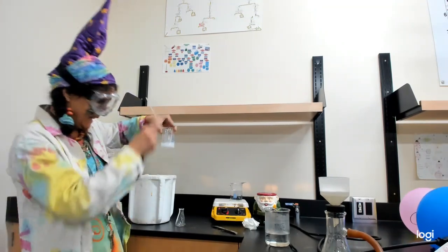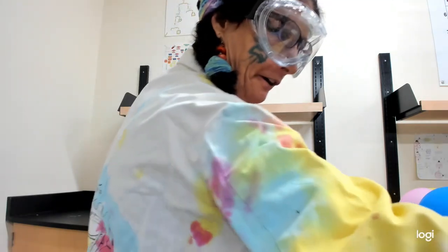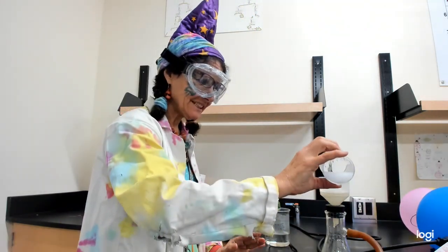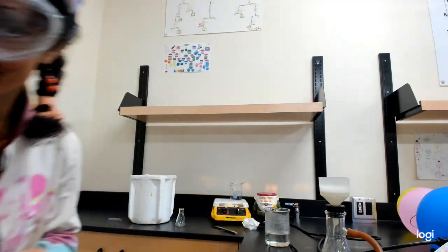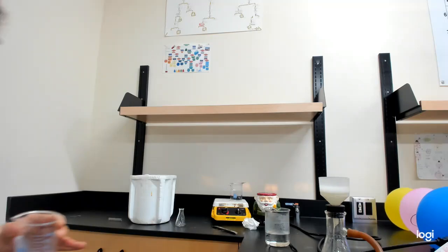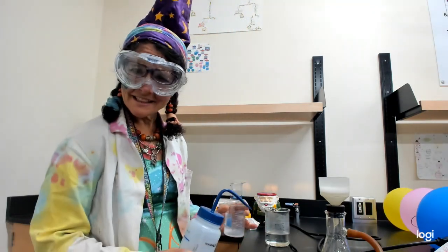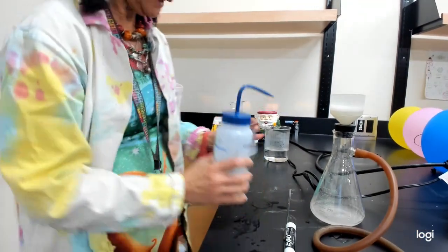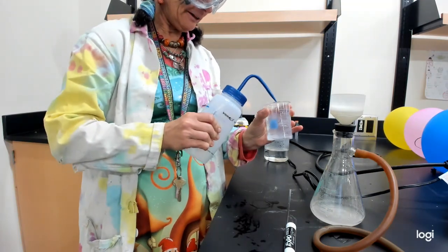So, take it out, give it a good swirl, turn on our vacuum, and the crystals this time are much finer. Here's the real question. Well, I believe it is a post-lab question. My solution down there is kind of cloudy. It's like some of my crystals I lost.